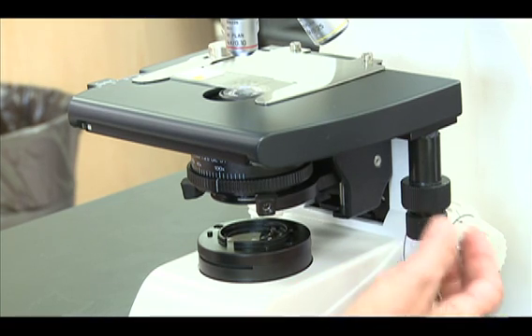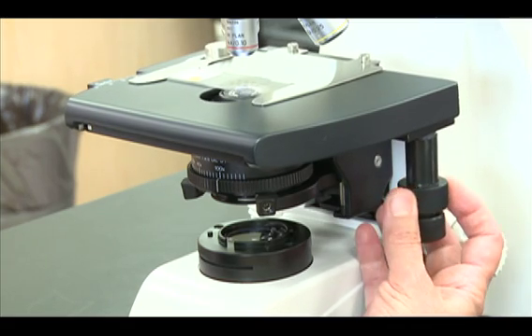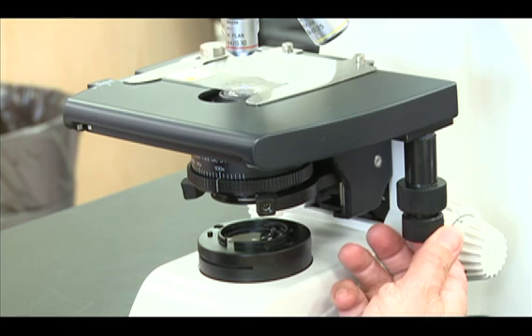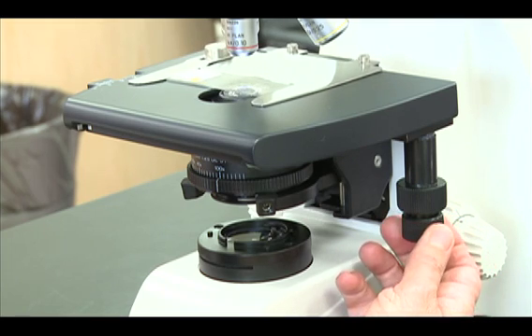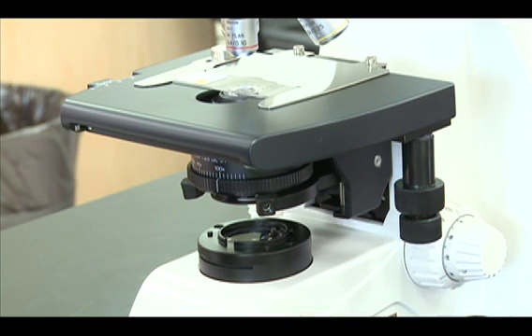Center the slide over the circle of light with the stage controls. The lower knob moves the stage left and right. The upper knob moves the stage front to back.